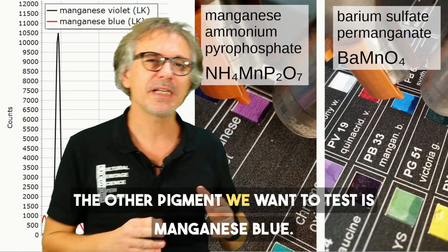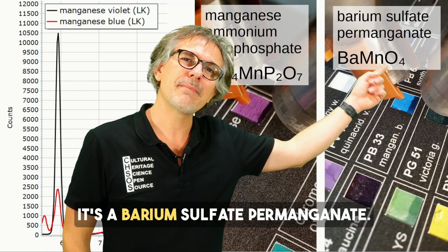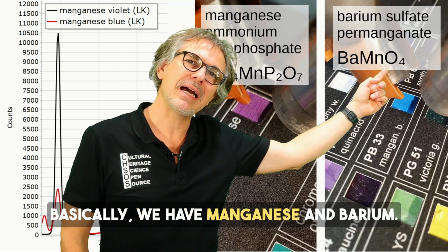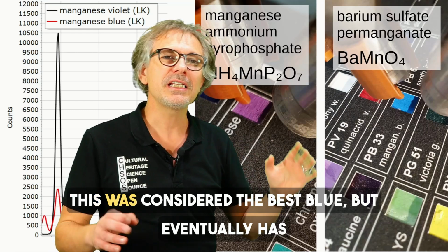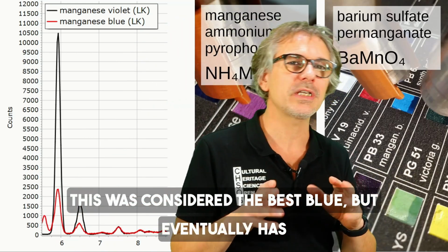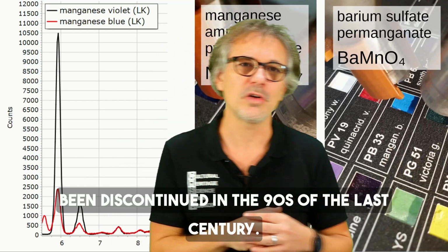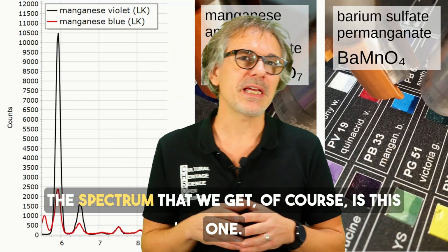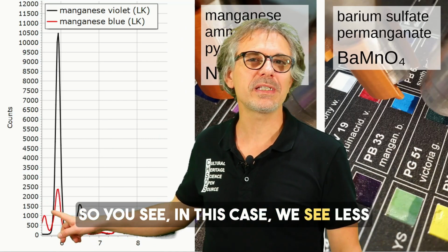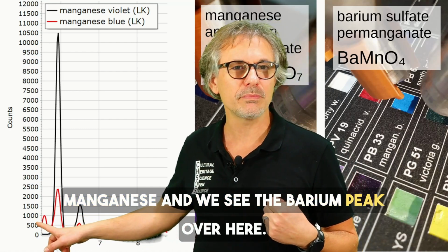The other pigment we want to test is manganese blue. It's a barium sulfate permanganate. Basically we have manganese and barium. This was considered the best blue, but eventually was discontinued in the 90s of the last century. The spectrum that we get, of course, is this one. So you see, in this case we see less manganese and we see the barium peak over here.